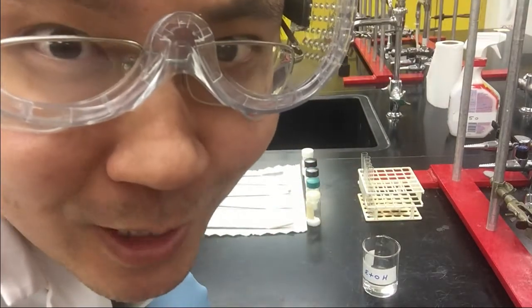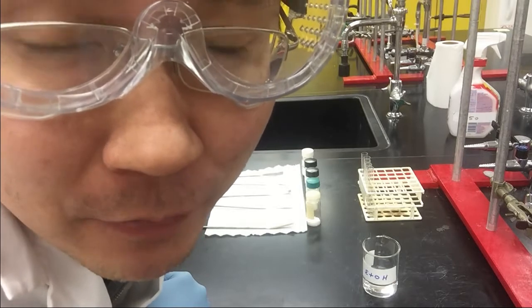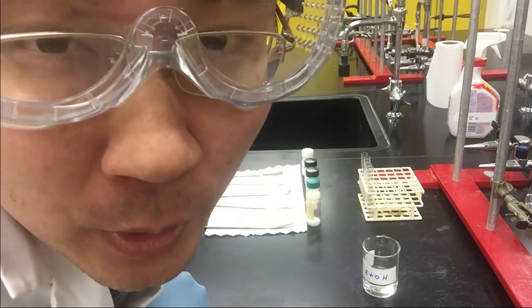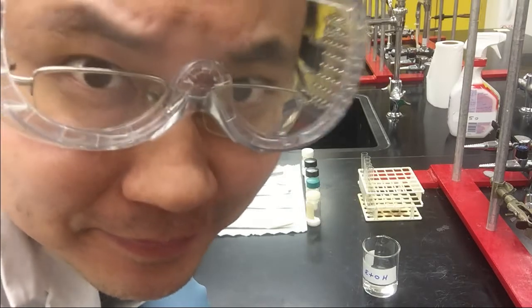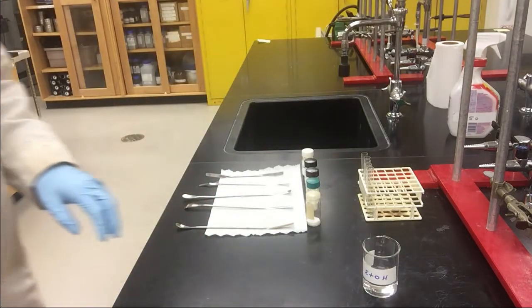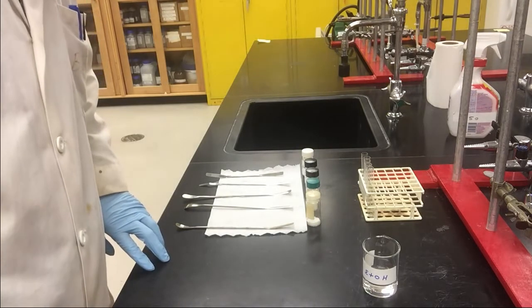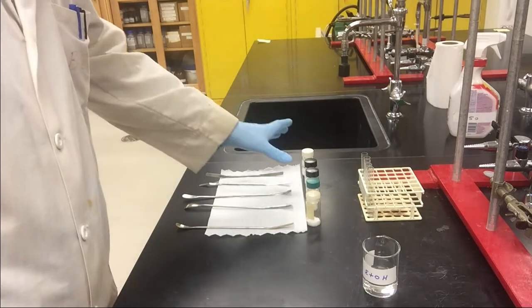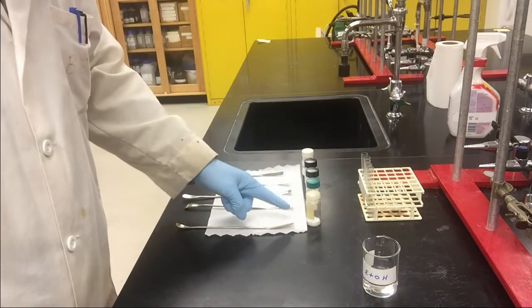Hello everyone, welcome to Organic Chemistry 1 Lab Experiment 5. Today we will learn how to perform TLC analysis. The first step is to prepare 5 samples. We have 4 standards here and 1 unknown.